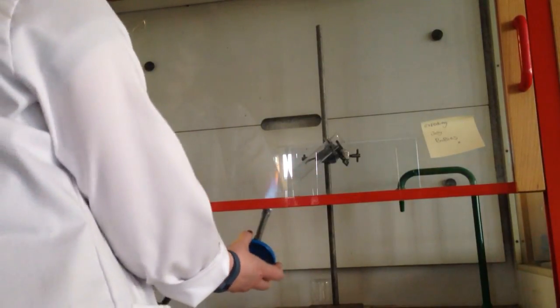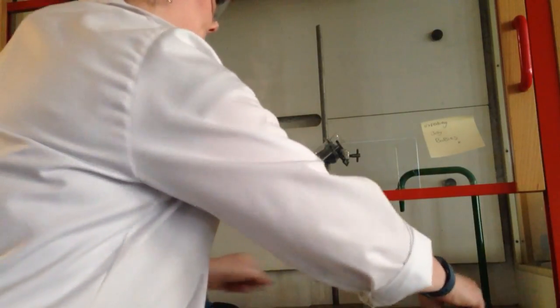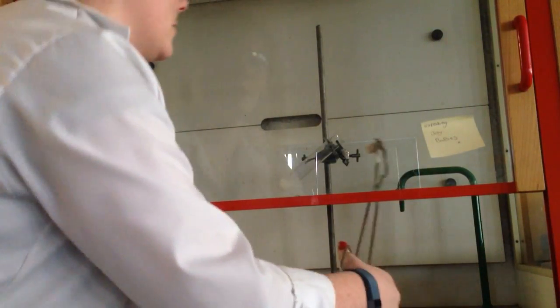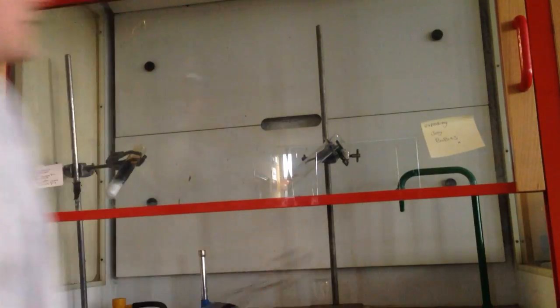Okay so that's nice and liquid now, I'm just going to turn the Bunsen burner off. I'm going to very quickly pick up my jelly baby, pop that in there.